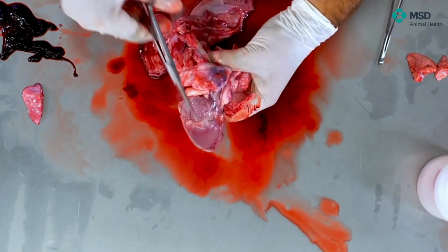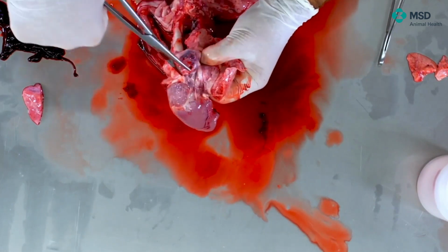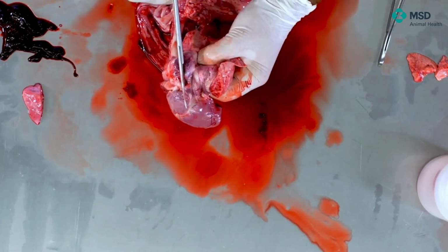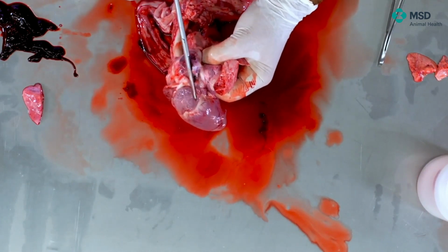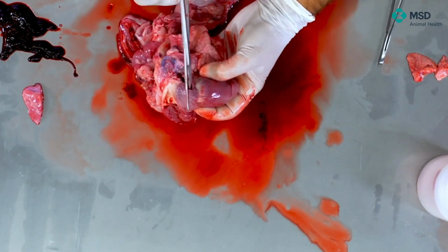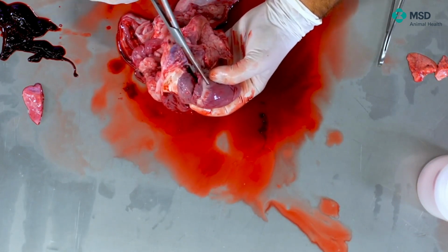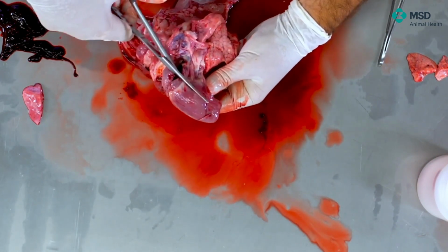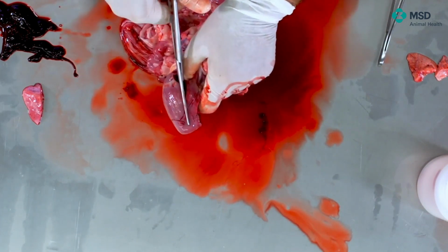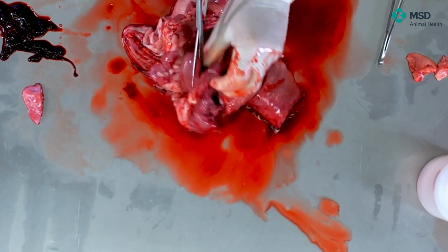So here, what we will manipulate will be the pulmonary veins. So I'm cutting the pulmonary veins. I'm entering into the left atrium. I will do again the L shape, so cutting there. So I do this L shape, and then again in the interface in the L, I will go into the interventricular wall, and I will cut again, following such interventricular wall and getting out from the aortic artery.